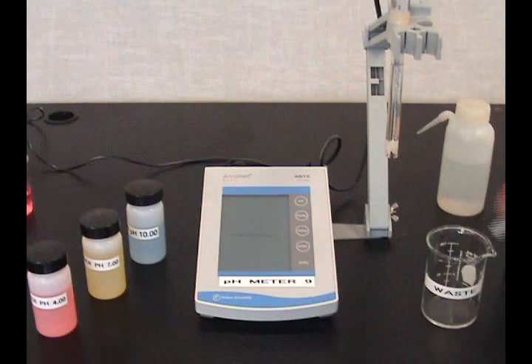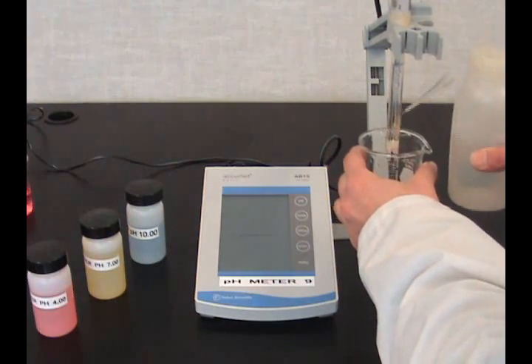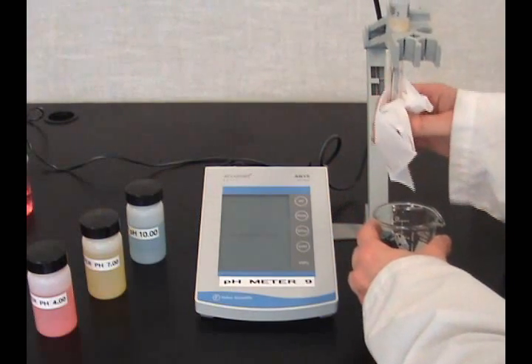Remove the probe cap. Rinse the probe with distilled water above a waste beaker. Blot dry with a kim wipe.